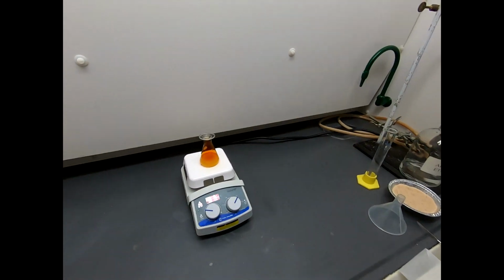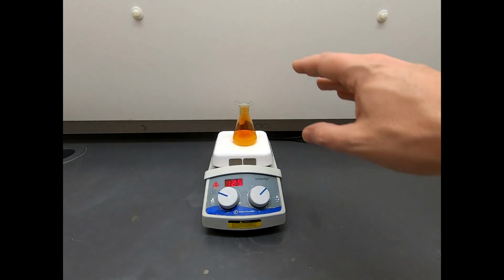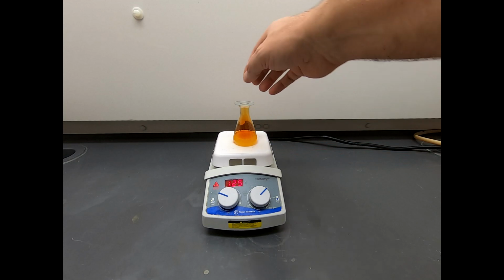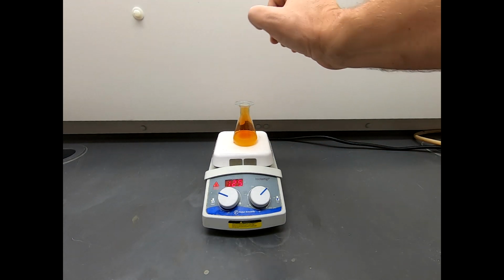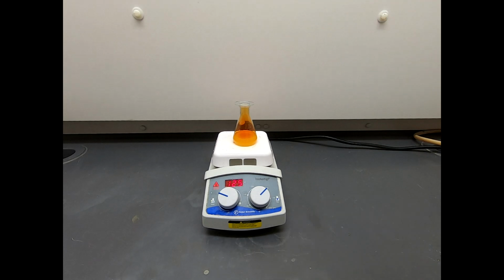Okay, third TLC. So here, this is at 40 minutes. Here's our product. Here's our starting material. It is starting to get really faint in here. Now, let's turn this off and take a walk over to the hood and see what we have here. You notice this is quite a bit lighter now. The brown color has tapered off quite a bit. So I think this is really essentially complete.